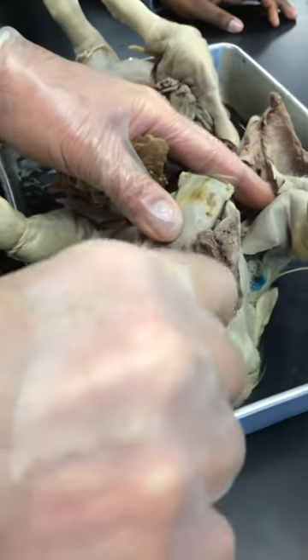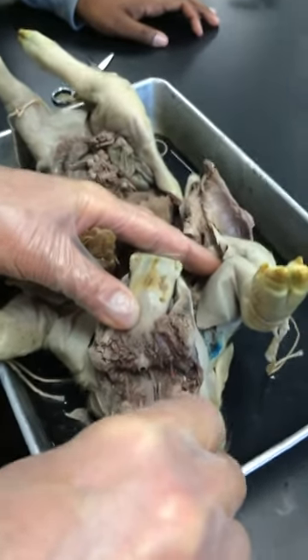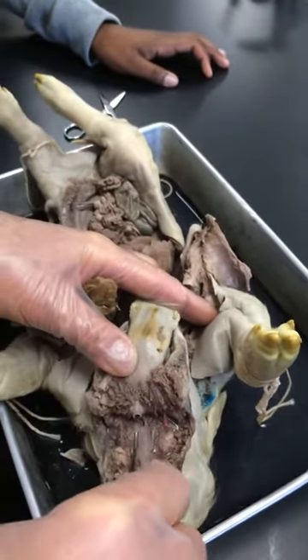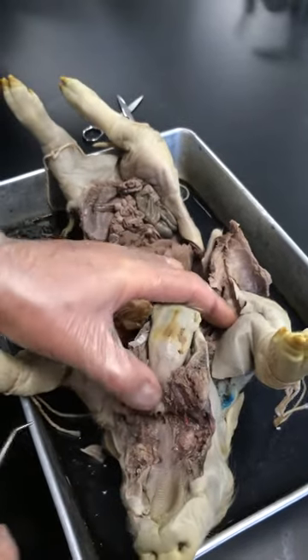Soft palate is the flexible part. There is no bony support there, that's why it has some give to it. It's continuous with the hard palate.